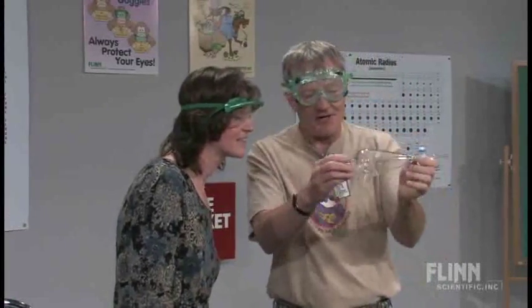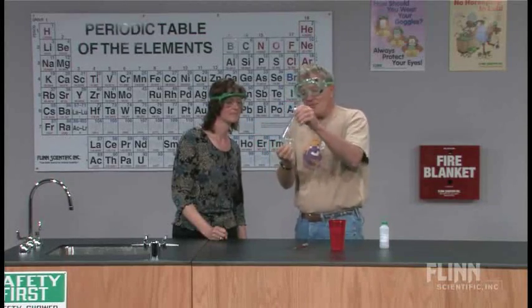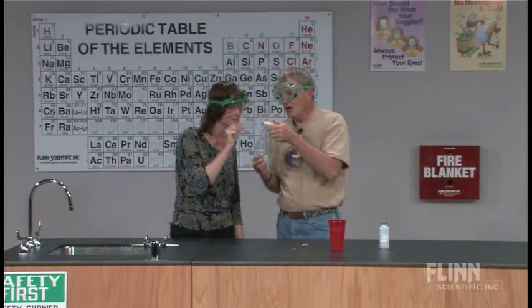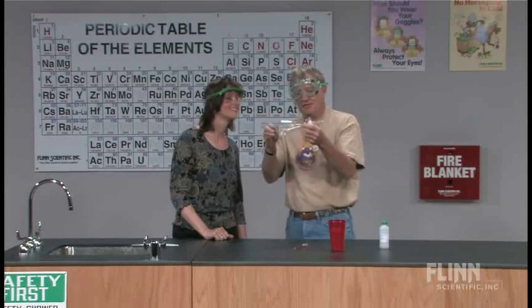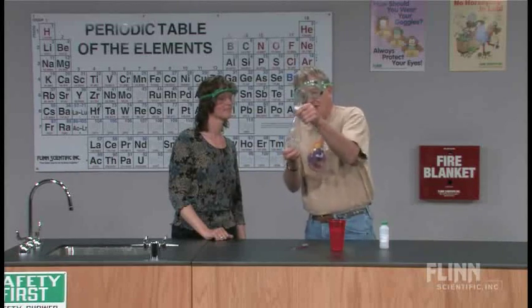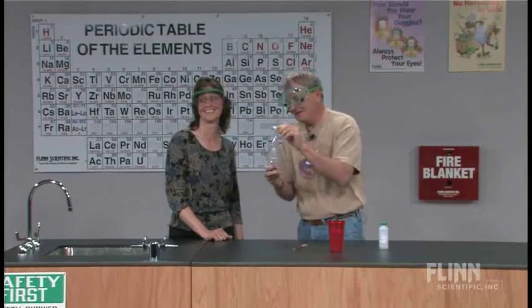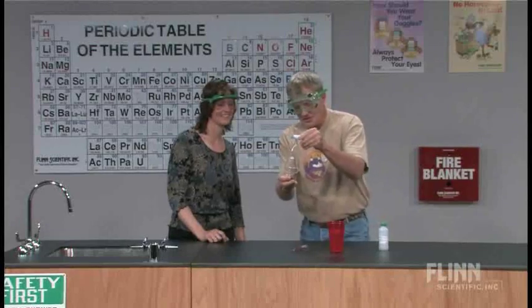And that makes sense, right? Because liquid's still evaporating. I know liquids evaporate. Okay, so I'll swirl it around. Listen again. What'd you hear that time? Oh, yeah, but it was really quiet. I wonder why. I guess I didn't shake it as much, right? Could be the case. So let me shake it some more this time. Shake it around some more. Okay, this must be great on the camera. Listening? Did you hear anything? A little bit. Okay, let's swirl it around some more.